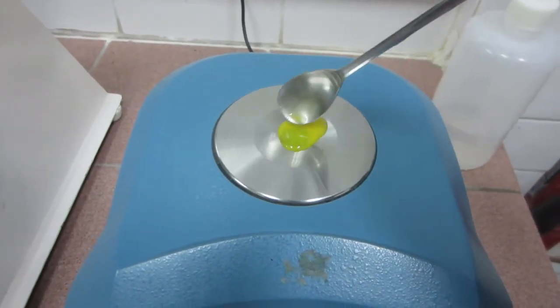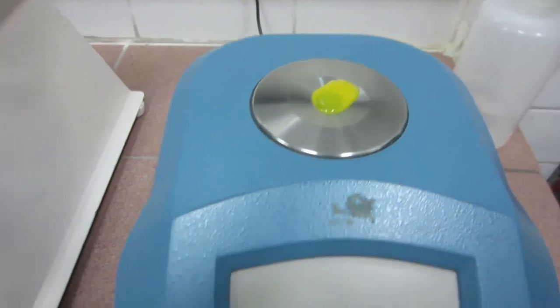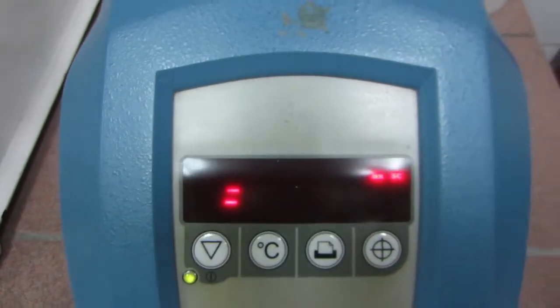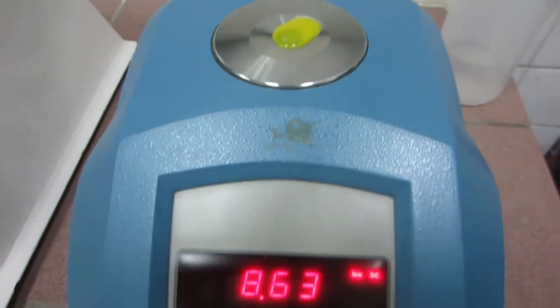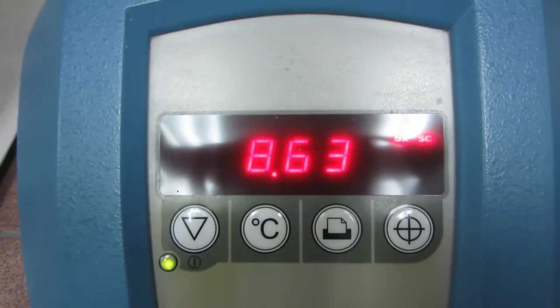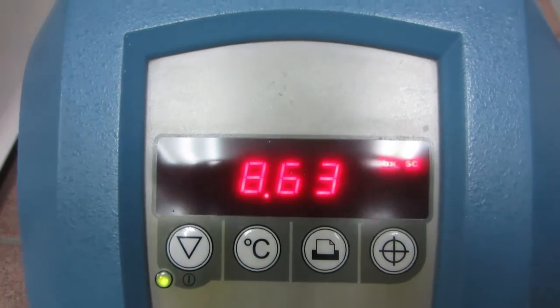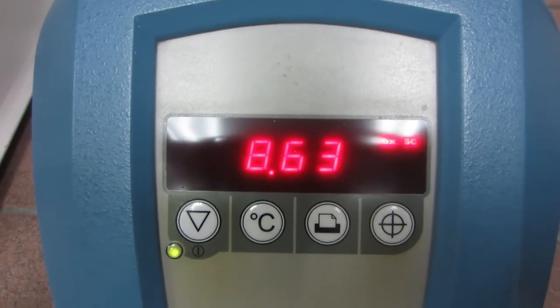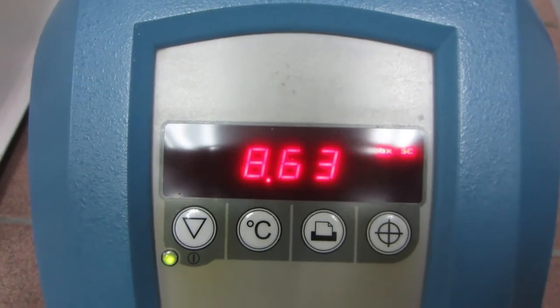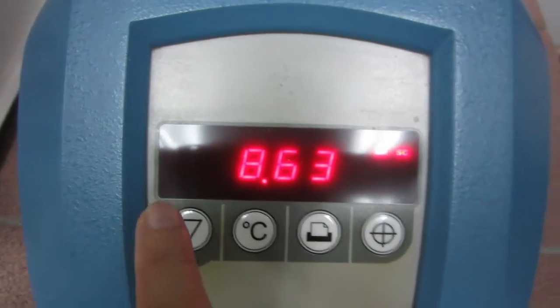Let's wipe it out and replace this with our liquid solution. I'll put it there and press this button. So we have a figure that comes out, meaning this is the sweetness of this certain liquid aqua solution.